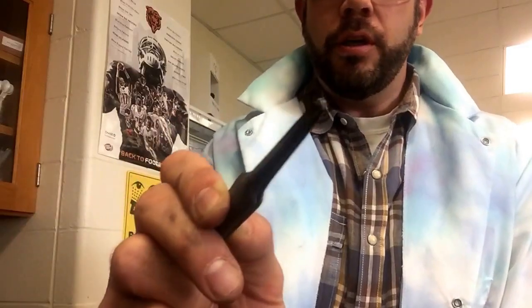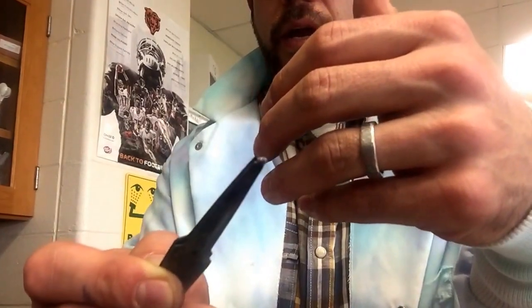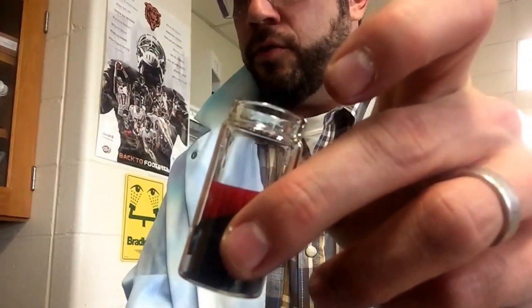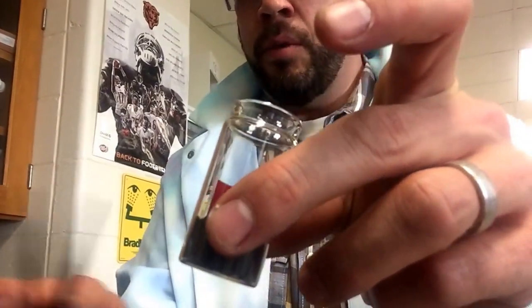Once you have got your piece of silver — I don't know how well you can see that, but I got my piece of silver there — then you're going to take it over and use a mallet and hammer to hammer it out. You can also clean it a little bit, but now that should look a lot more like the silver piece of metal. All that happened was I got the piece of charcoal so hot that it was able to donate its electrons. And I'll show you what that is on the board.